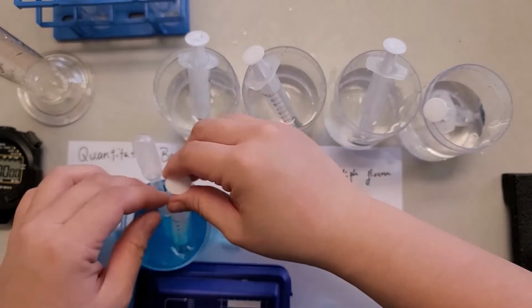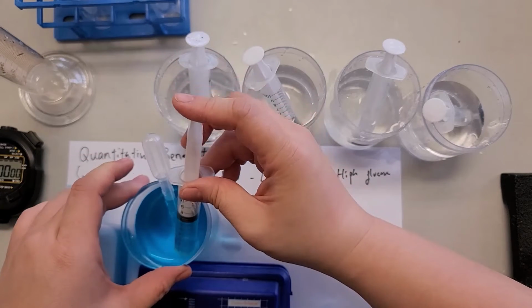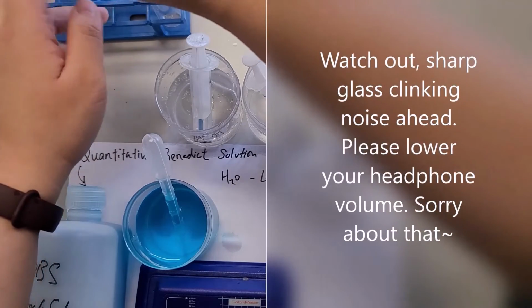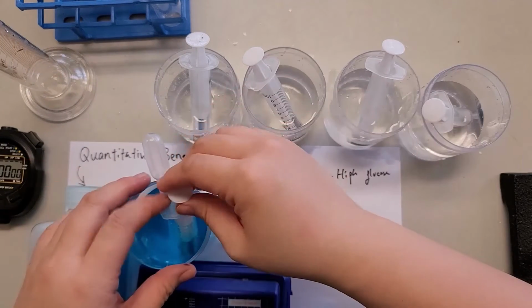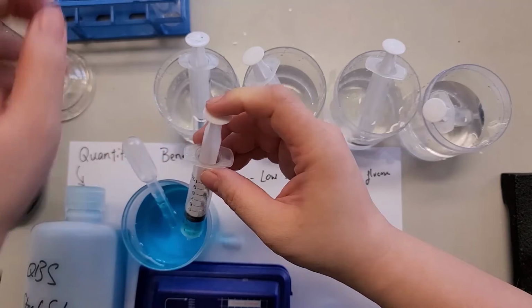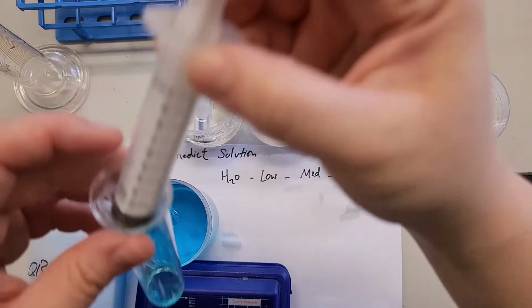So I can extract 3 ml of it first into the boiling tubes. Since we have 4 samples, we just put it into the 4 boiling tubes here.